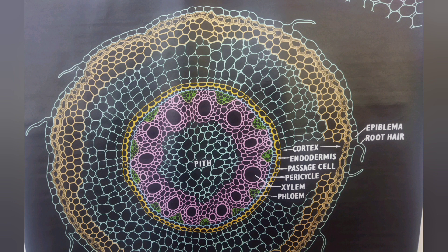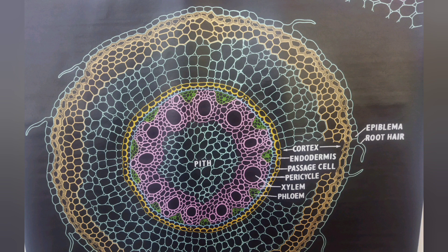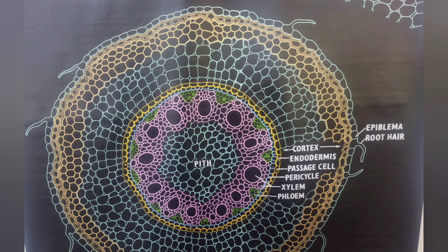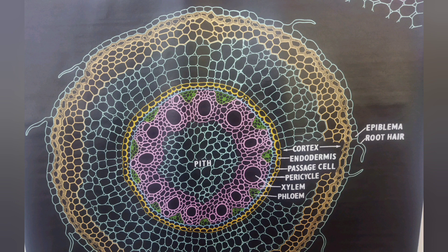Presence of root hair — this is a piliferous layer. This is a rhizodermis. Root hair is single cell. The cortex is a very large cortex, radially isodiametric, thin wall, loosely arranged parenchyma. This is a large intercellular space. Presence of root hair cells, sub-epidermal cell layers.